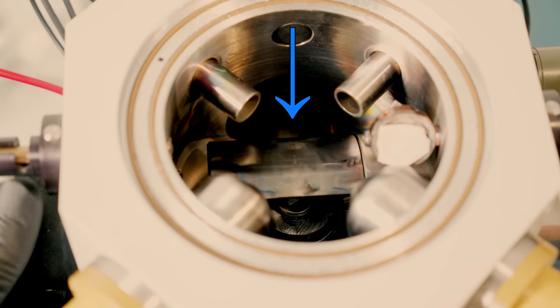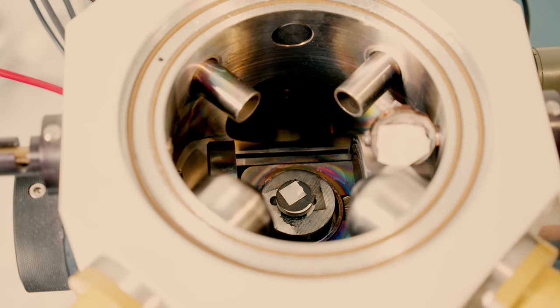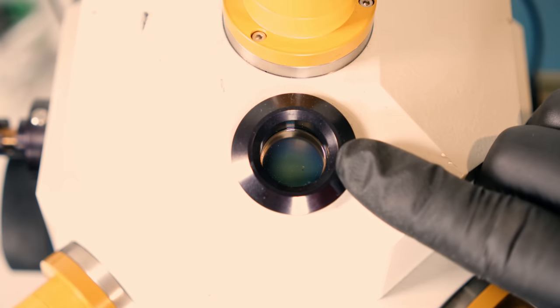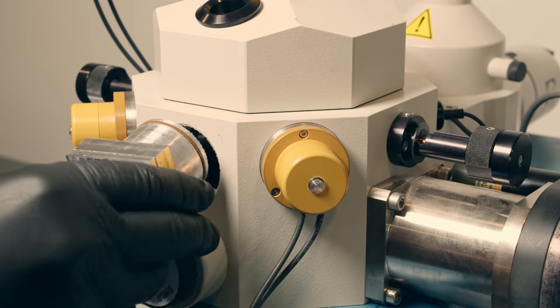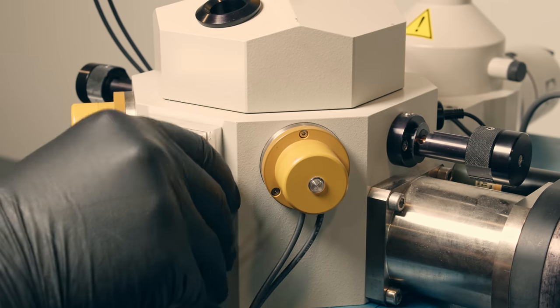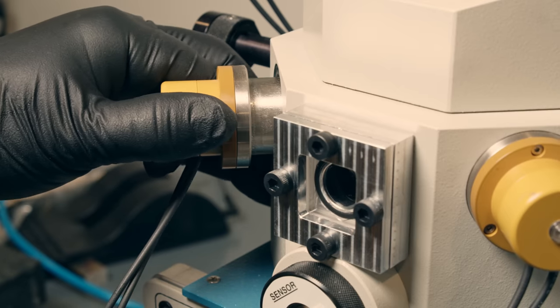Now under normal operation, the top ion gun shoots straight down onto your sample and begins to etch it. But that's kind of hard to see in the video, especially with this tiny little viewport. So I built a secondary viewport which goes onto the front of the chamber, and it gives a better view of these two other ion guns that are on the machine.